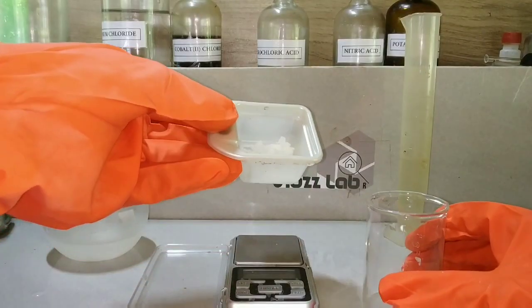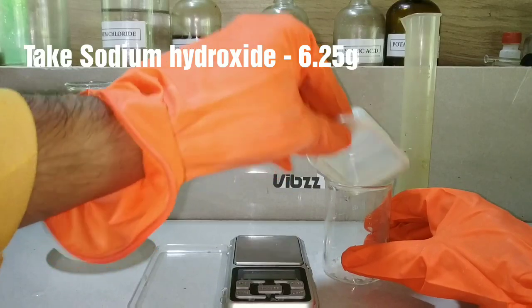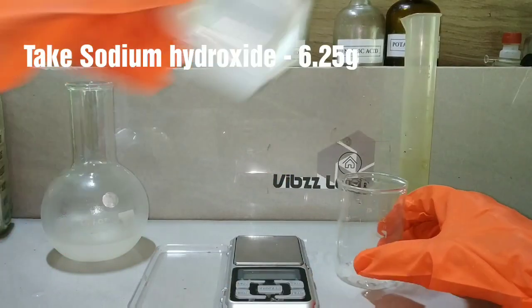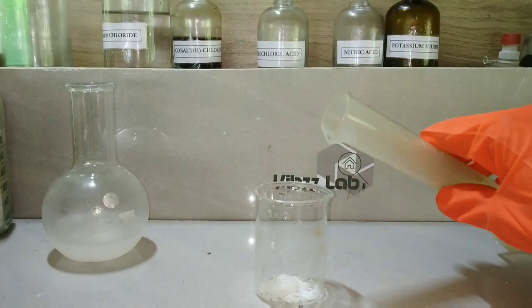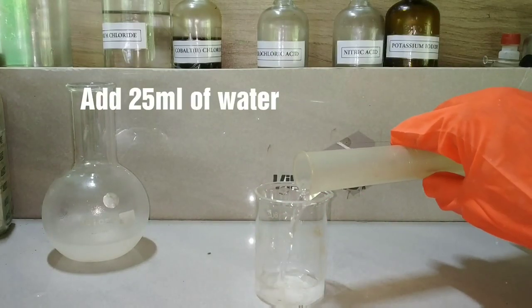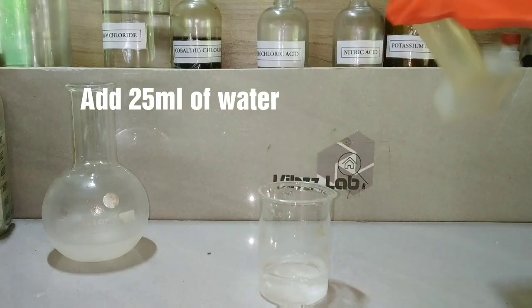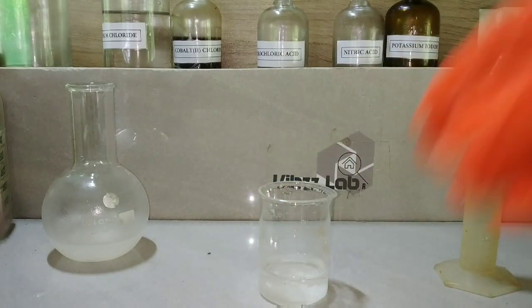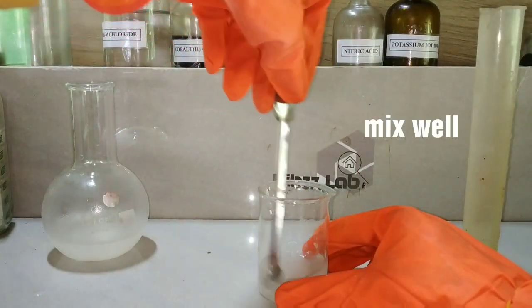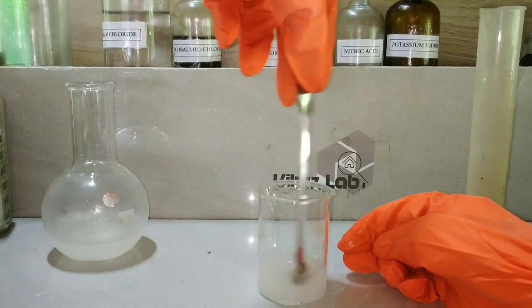Now we weigh out 6.25 grams of sodium hydroxide, take it in a beaker, and we will be adding a very minimum amount of water — only about 25 ml — and dissolving the solid sodium hydroxide in it. This step generates a lot of heat, so we have to cool this solution before proceeding to the next step.